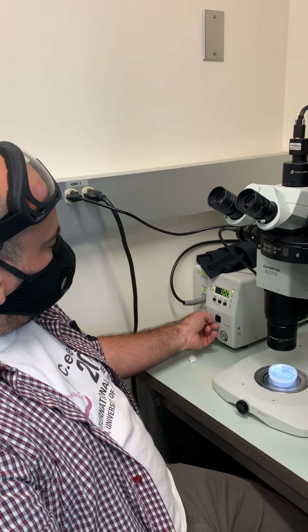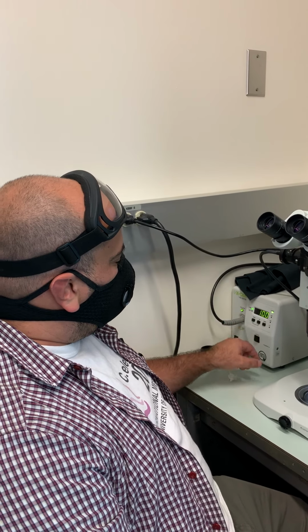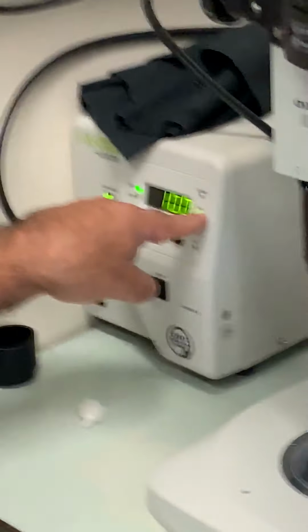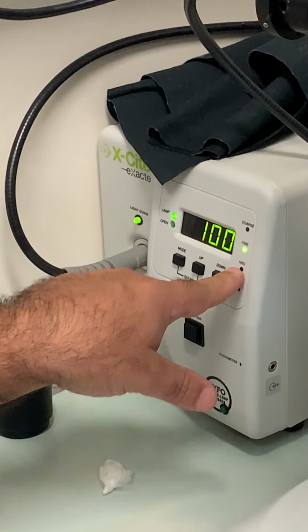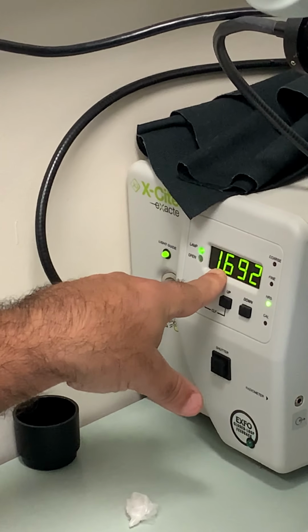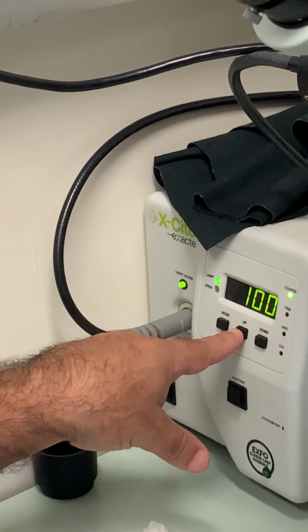When you turn it on for the first time, it's going to take some minutes to warm up. These numbers are going to be blinking, and eventually they're going to go solid. There is a button here for the mode that tells you whether you are changing the coarse, the fine, and how many hours this lamp has on it. I'm going to go to the coarse adjust, and then you see up and down.